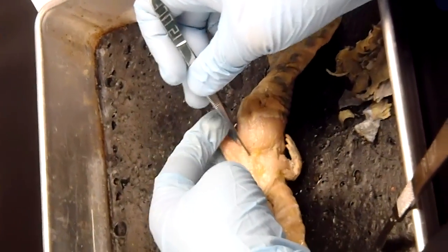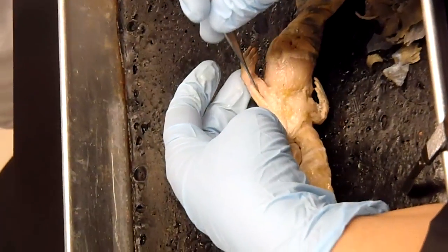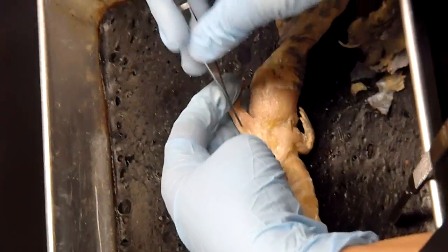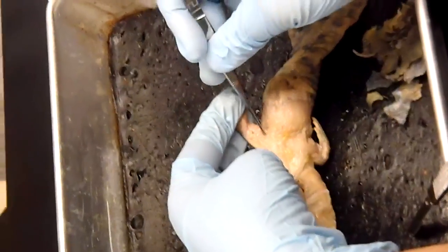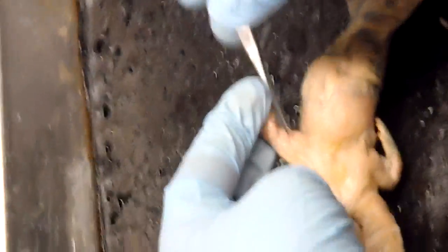And then Pubo-ischio-femoralis Externus, which is the big one. And then that is going to transition into Internus, which is the first one right here. And then you have Pubo-tibialis, which is this guy.